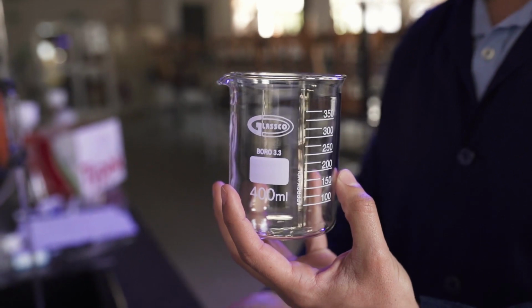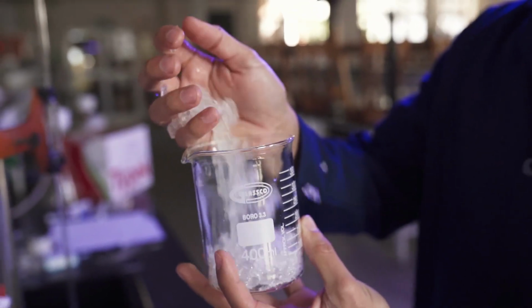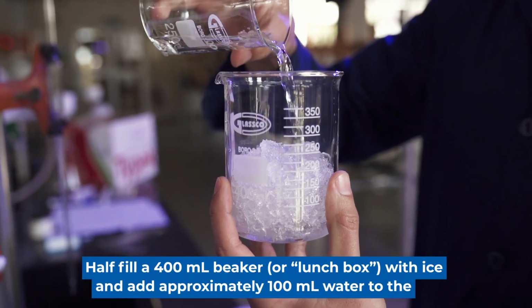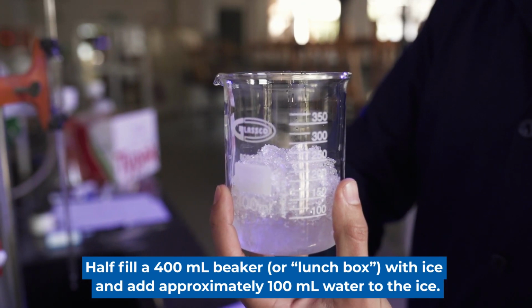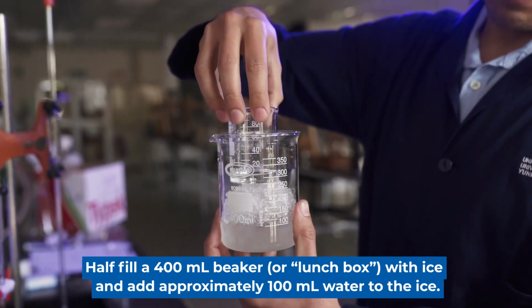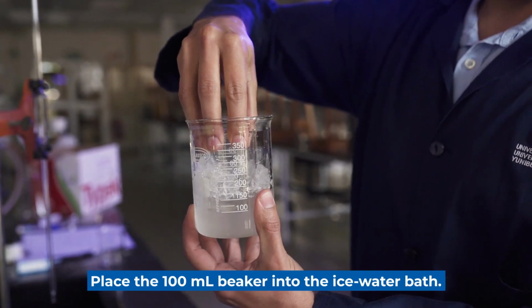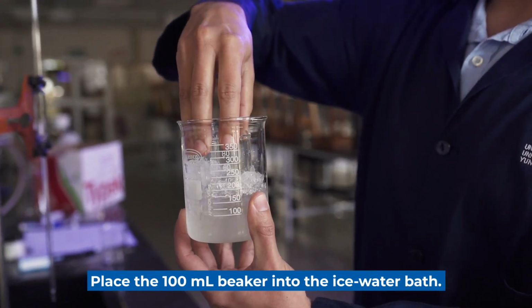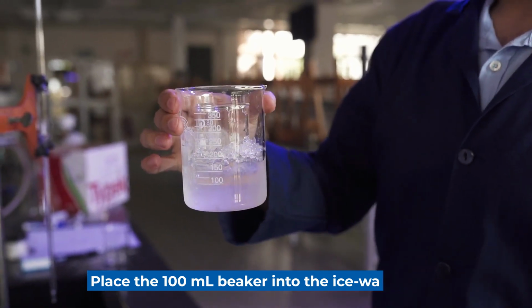Now that the potassium nitrate solution is ready, we are preparing an ice bath for recrystallization. Fill the beaker halfway with ice and add water to make sure that the beaker containing the potassium nitrate solution is in contact with the ice cold water. Make sure that the meniscus of the potassium nitrate solution is beneath that of the cold water.